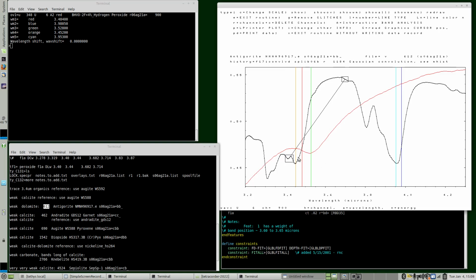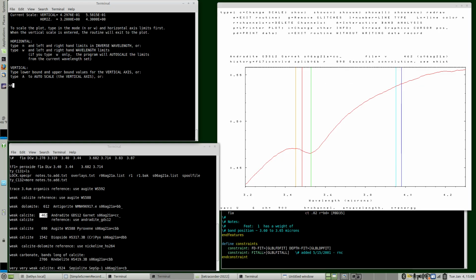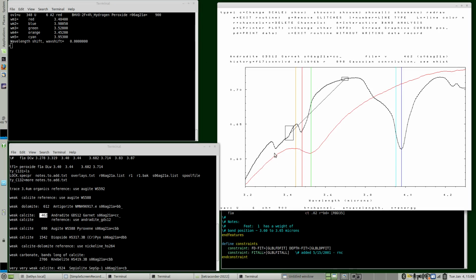So is it due to calcite? See, the band position is shifted longer and closer to the peroxide position. But we'll try this one. Here's a weak calcite. You can see these absorptions are pretty strong, and even this is a weak feature. It's not a pure calcite spectrum because it's dolomite in an antigorite sample. So let's plot a weak calcite feature. And we see it too doesn't work for this kind of broad feature. So the idea that it was a carbonate threw me.